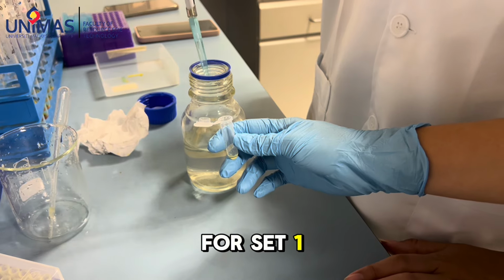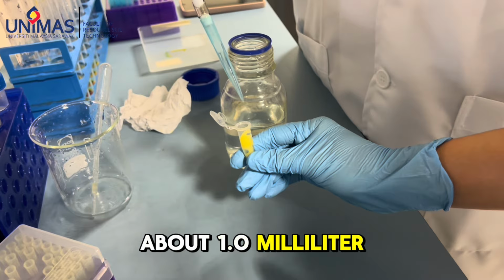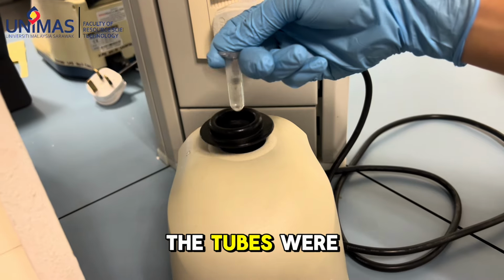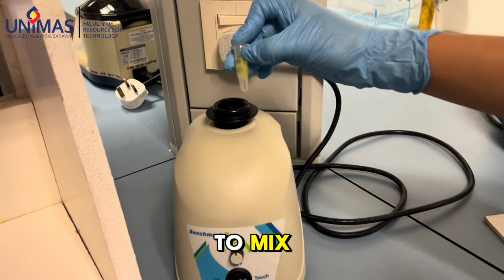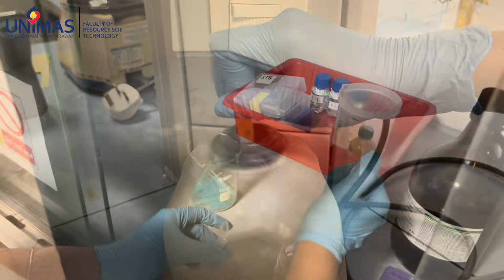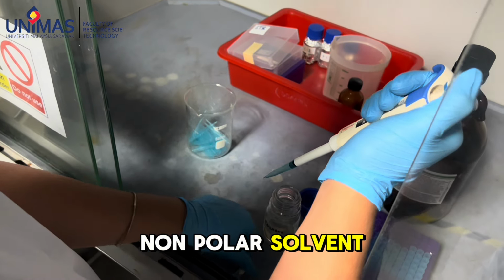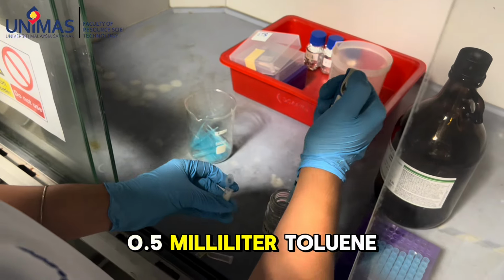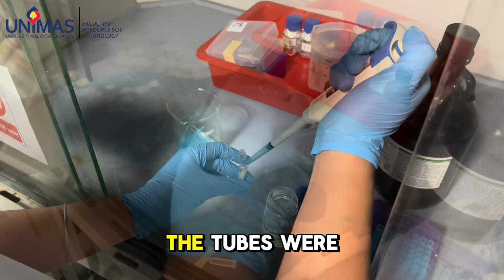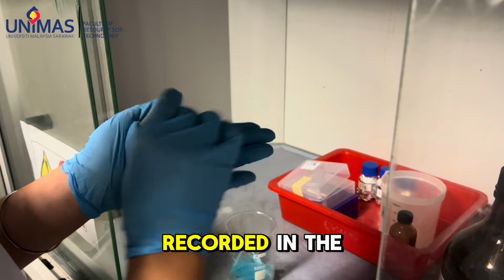For set 1, solubility in polar solvent, about 1.0 milliliter of water was added to each centrifuge tube. The tubes were capped and shaken to mix. The observations were recorded in the table. For set 2, solubility in a non-polar solvent, 0.5 milliliter toluene was added to each sample. The tubes were capped and shaken to mix. The observations were recorded in the table.